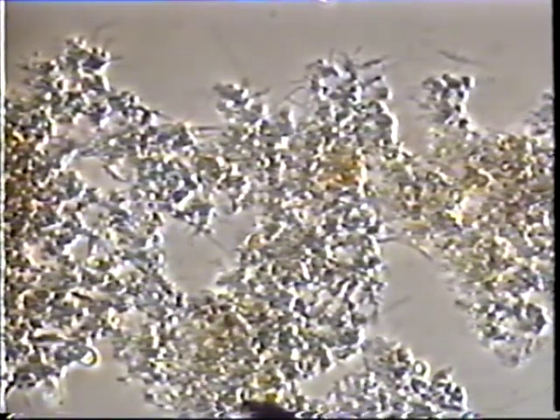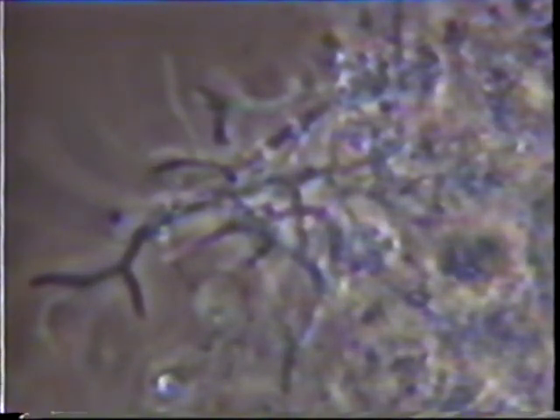Nocardia is found mostly within the floc. This filament causes foaming, but not bulking. Nocardia is a short, thin filament with characteristic true branching. This is the only bacterial filament with true branching. This filament is Neisser negative, but strongly Gram-positive.